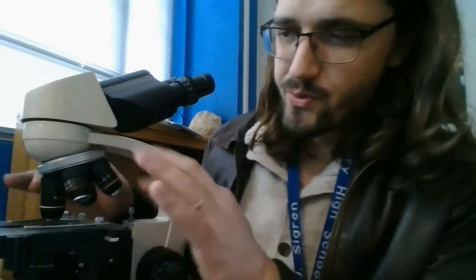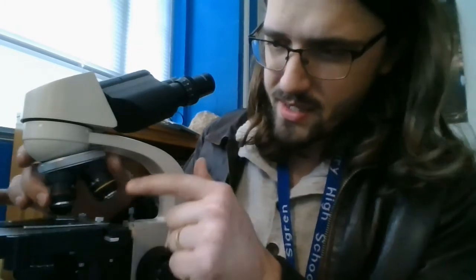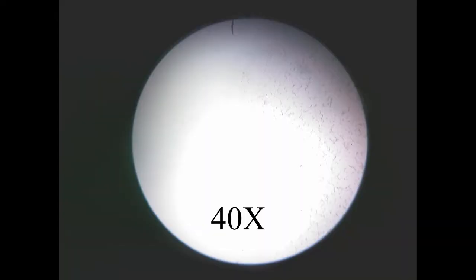So what can you actually see at 400 times magnification? Let's start with looking at a few bacteria here. These are dead bacteria that are stained on a slide, and we'll see what these bacteria look like through our 3 objectives that we're going to use. So we'll look at bacteria with the 40x, the red one, the 100x, the yellow one, and then the 400x, the blue one. Let's see what it looks like.